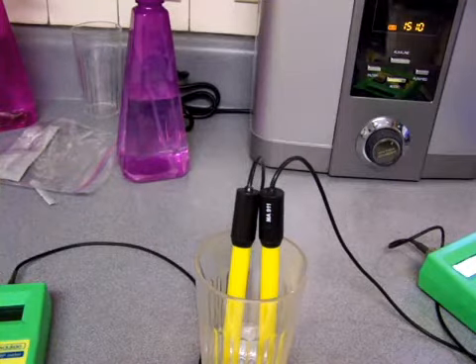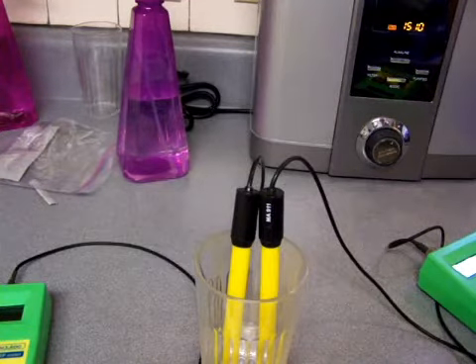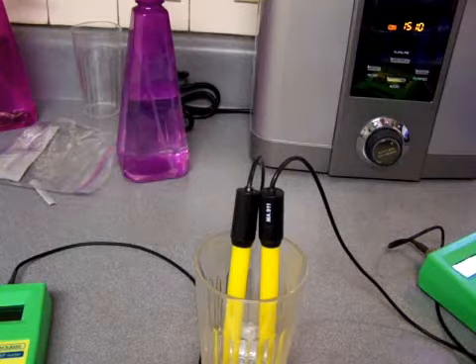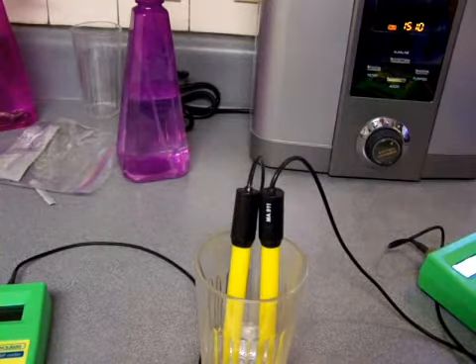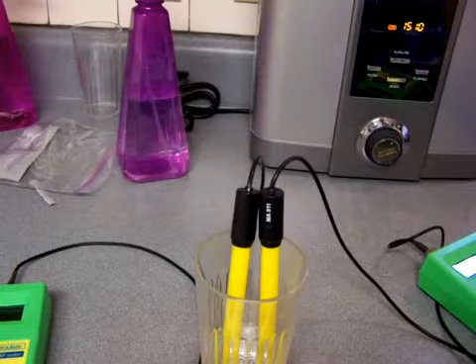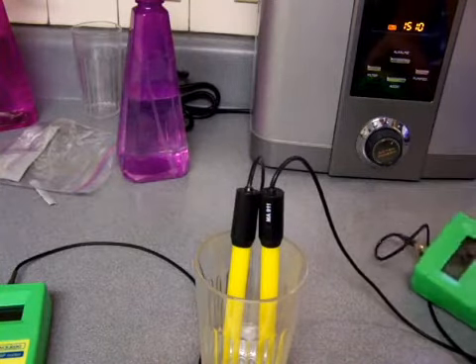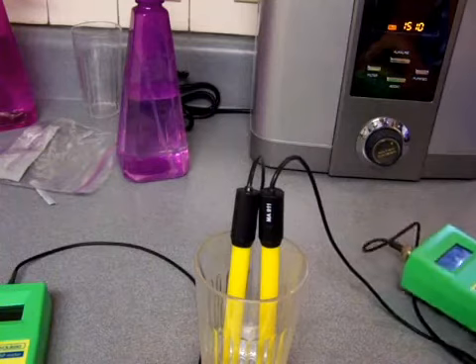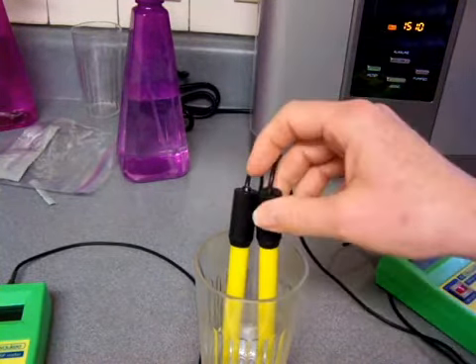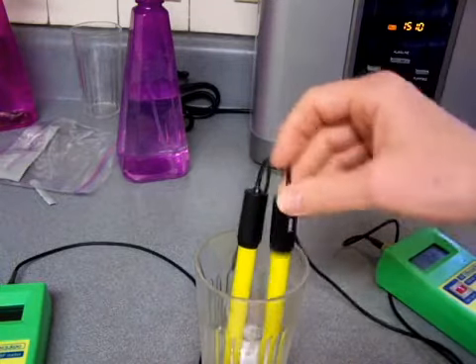And so I had to start looking around and asking, and I asked the various technicians at the ionizer warehouses and things like that, and I found out how to clean the ORP probe much more quickly than using those solutions. Now you still can use those solutions. I actually don't though, because this is just so efficient and it does it real well.